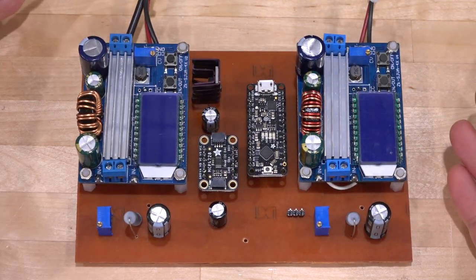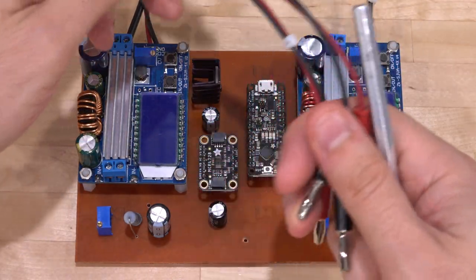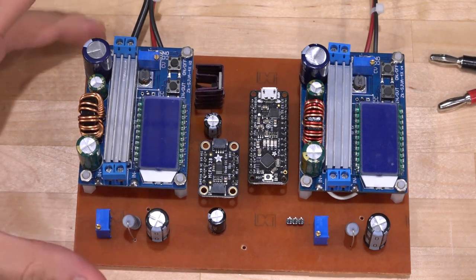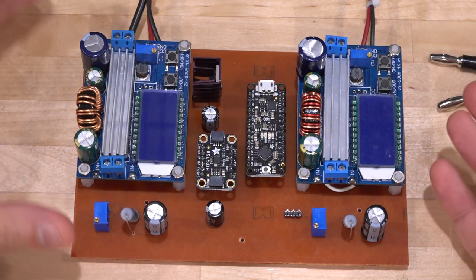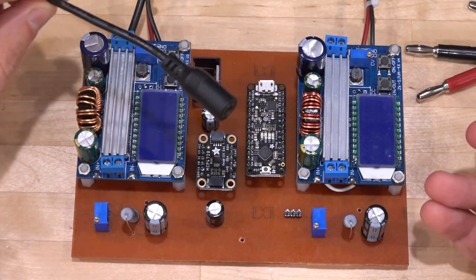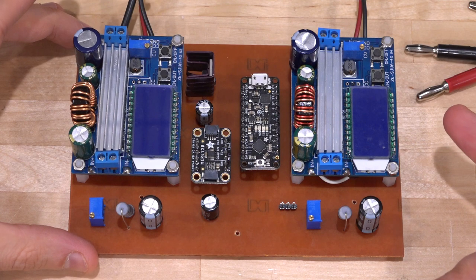And that's it. So all we have to do is connect these two connectors that already have the appropriate plugs at the end, connect them to the power supply that comes from the actual microscope, and we're done. And the source of this has to come from a different power supply, because remember that the power supply from the microscope is just varying from 1 to 12. So I have a separate 12-volt power supply that I feed this whole thing with, and everything is actually fully isolated. It works really well. Let me show you.